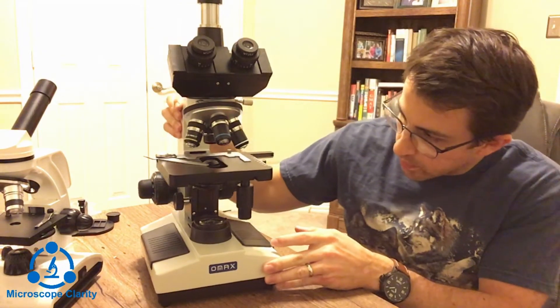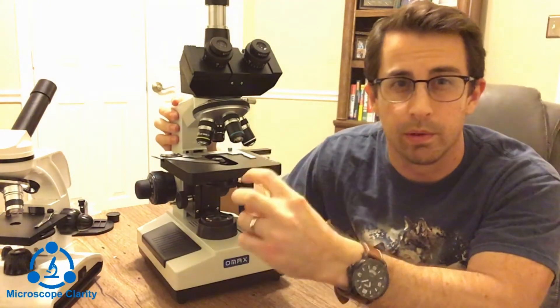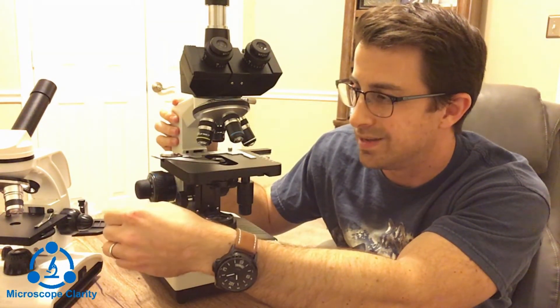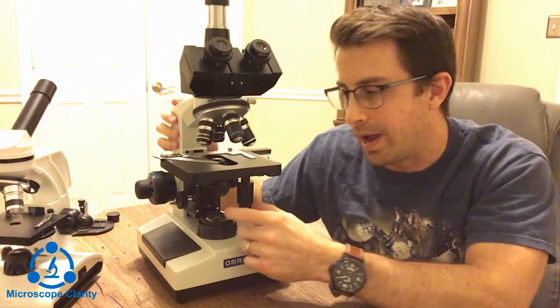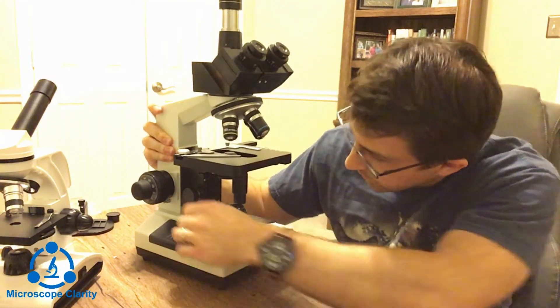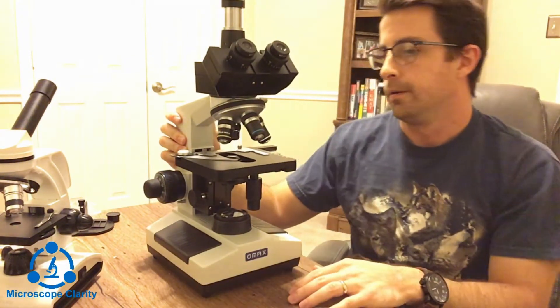Another difference on this microscope is the Abbe condenser lens, which is made up of two spherical lenses. The simple microscope has a single condenser lens with a 0.65 numerical aperture, while this Abbe condenser has a 1.25 numerical aperture. There's also a condenser rack knob that raises and lowers the condenser.